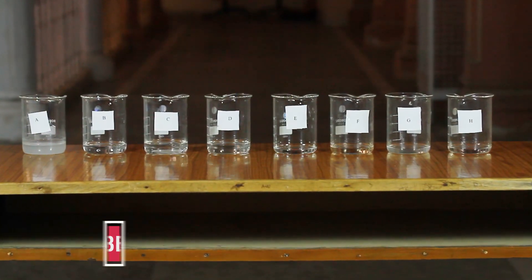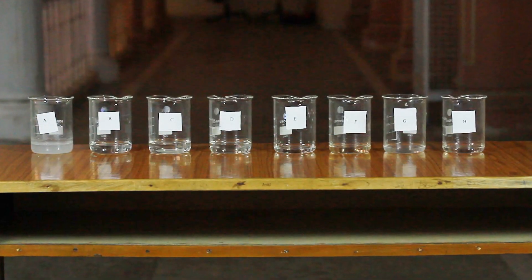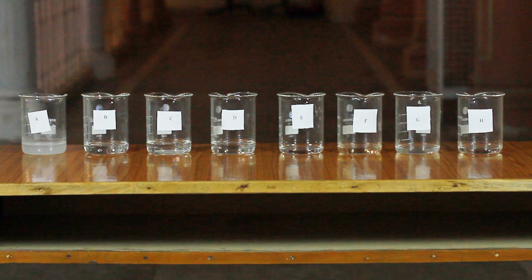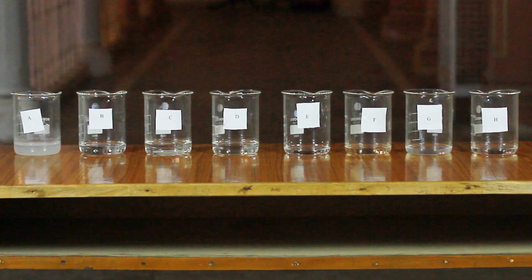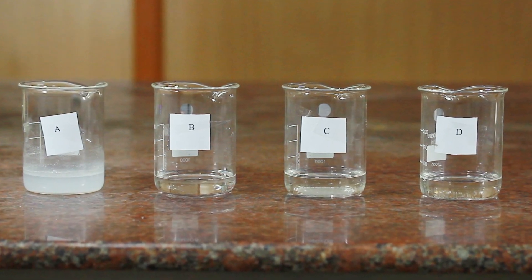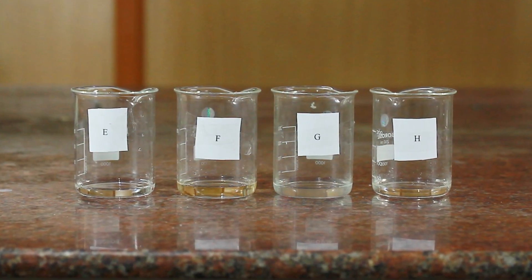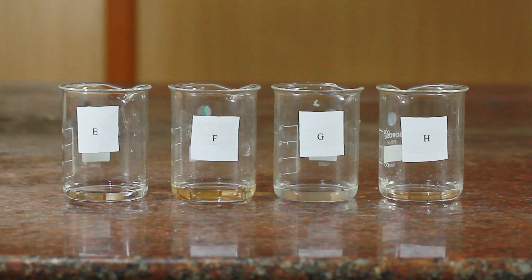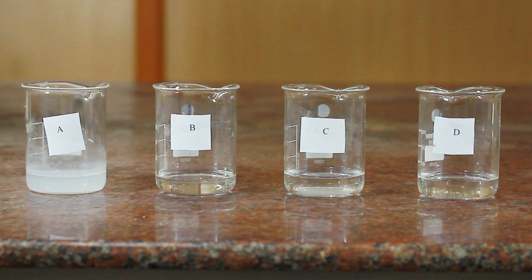On the workbench, place eight beakers and mark them as A, B, C, D, E, F, G, and H. In beakers A, B, C, and D, sample solutions are made and kept respectively. In beakers E, F, G, and H, add 20 ml of dilute sulfuric acid in each beaker.